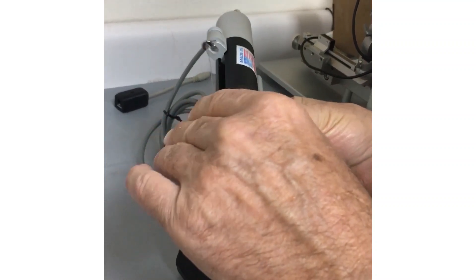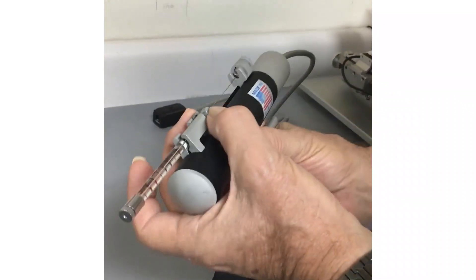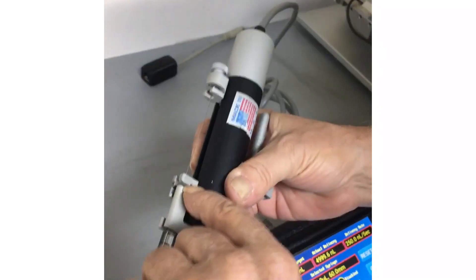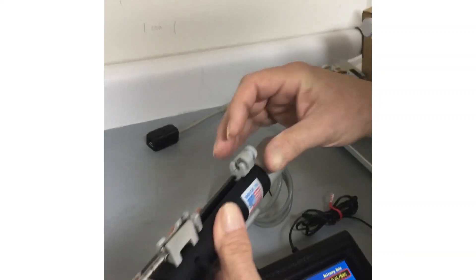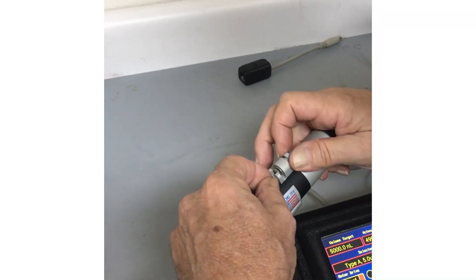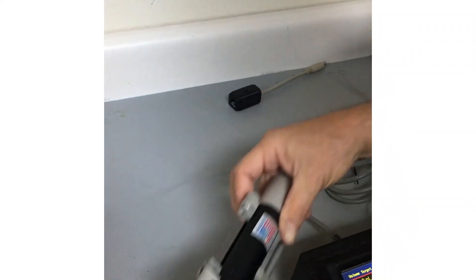When this first comes out of the box, it is tightened down. We give them a screwdriver — they need to loosen the screw so this is a little bit floppy, so that this gap will open up here, and then they're supposed to tighten it down again a little bit. The only way to get in there is to drive this all the way back. So I'm just going to set up this syringe and screw this down so that it's all lined up in there — perfectly in alignment.